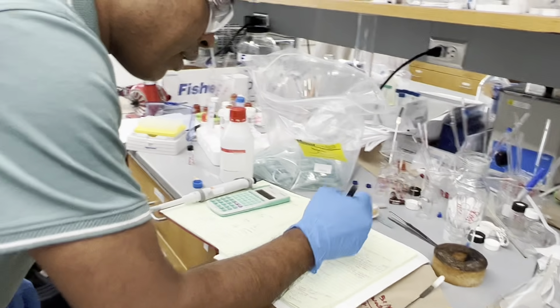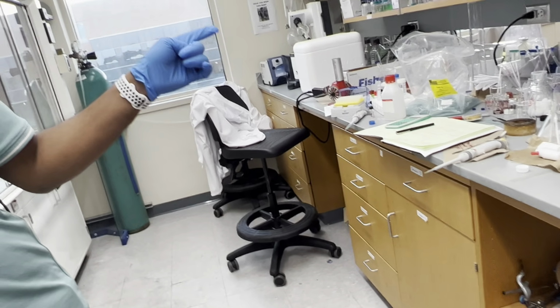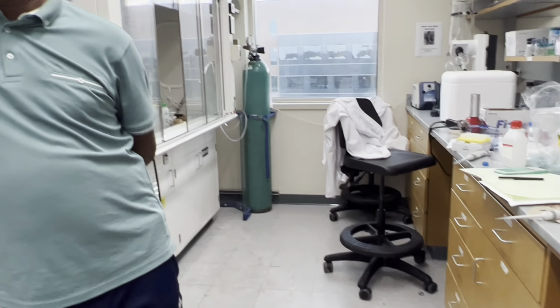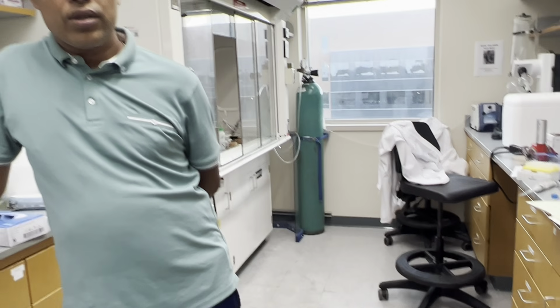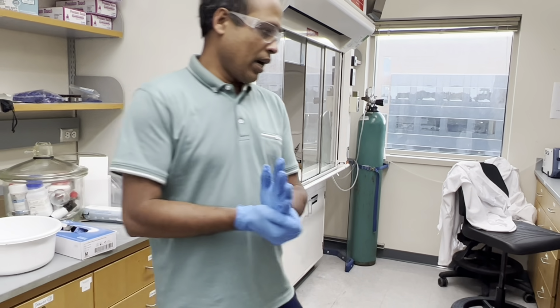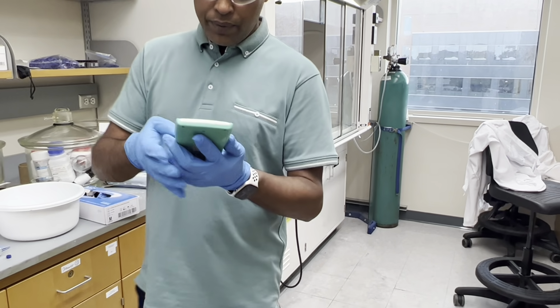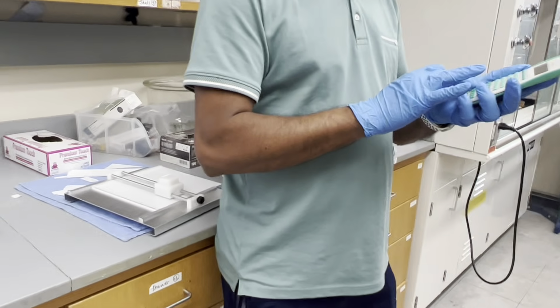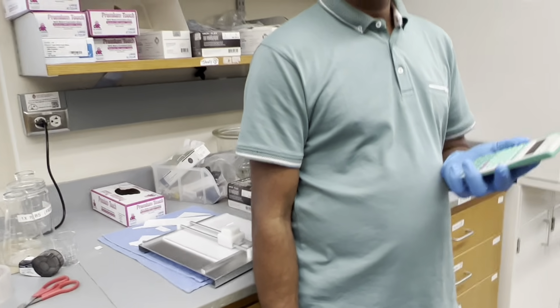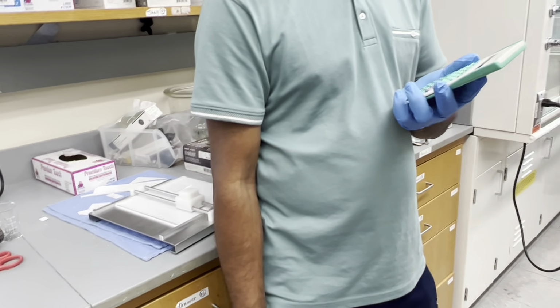Yeah, so here stock solution 50 microliter DMSO here. Right. Okay. So if we take total volume 400, we need 400 microliter DMSO. But right now, how much DMSO have we added? 350 plus however much you just added now, right? 110. Yeah. 460. Right? Because you added 10 microliters of the acid. Yes. So 460, right? Everything total together. Oh yeah, 460.